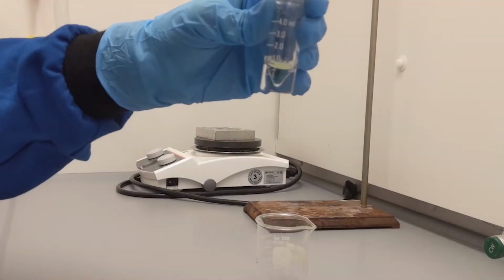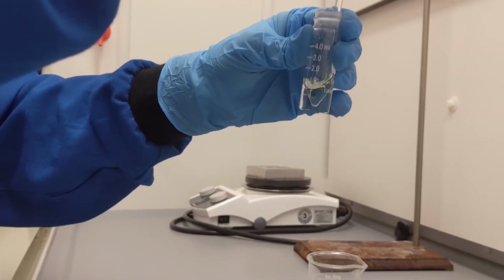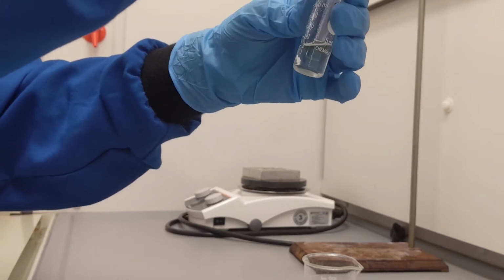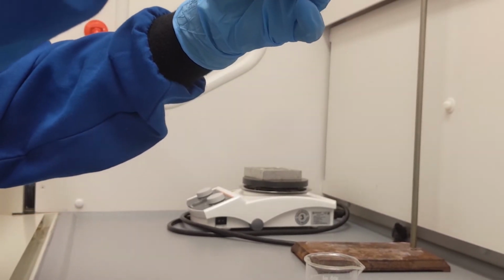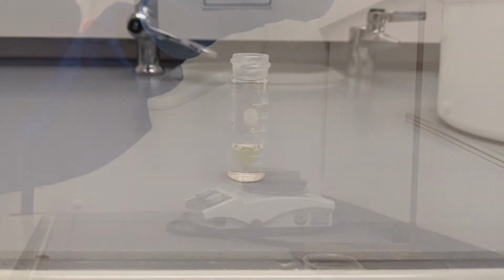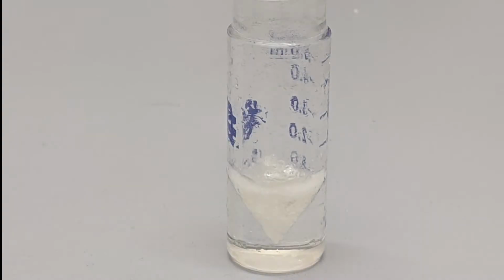If the crystallization does not begin, you can use a glass rod to scratch the edges of the walls to induce crystallization. If instead of white crystals forming, you see a color change, your reaction may have impurities and may not have occurred like it should have. You may want to start over. In the end, you should see white crystals.